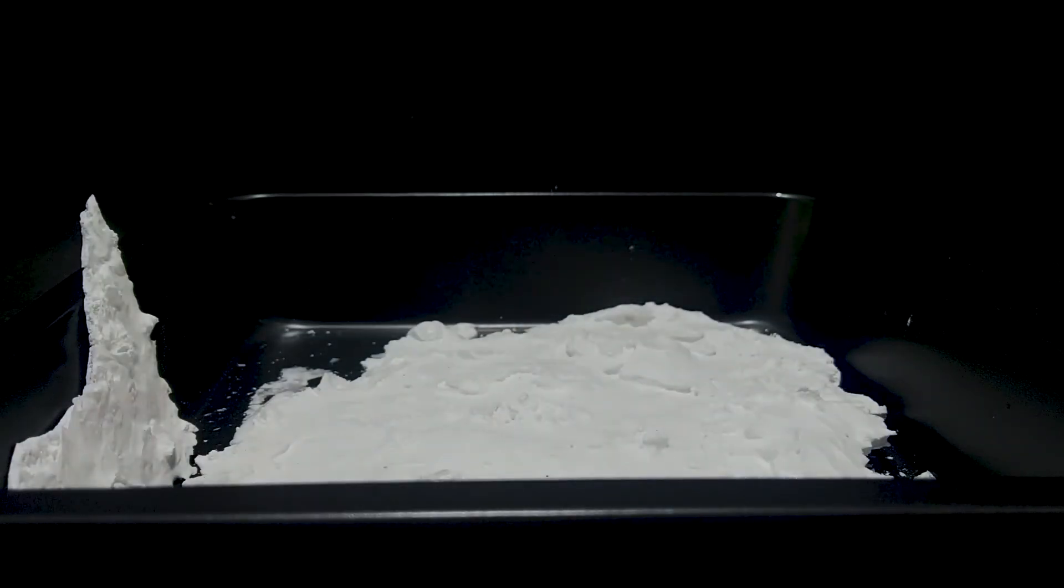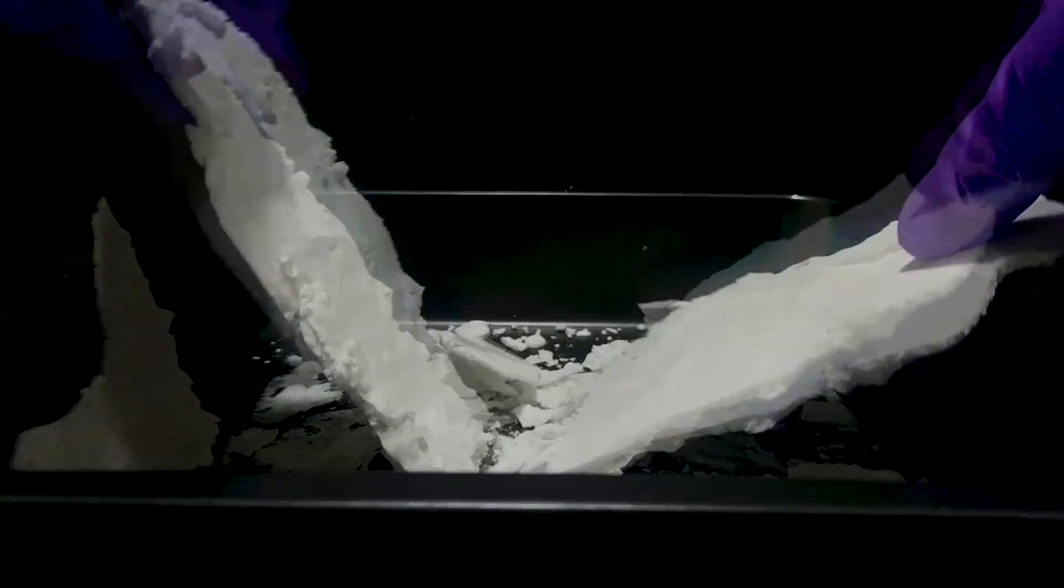It's quite simple. All you need to do is put the crystals in the oven, then hold it at 160 Celsius, or 320 Fahrenheit, for about 1 hour until it's completely dry.